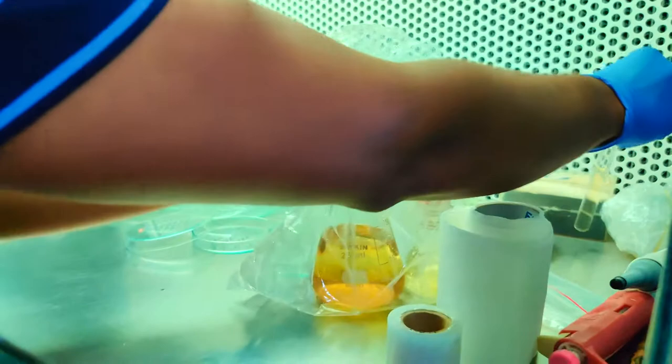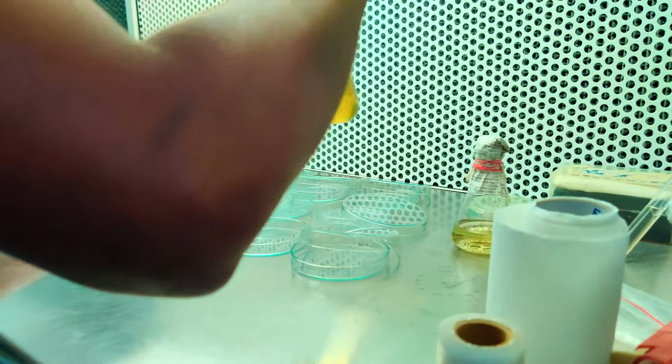Here, the broth we are taking out, and then we will take out the agar safely and carefully. If you are breaking it, that's all your one to two hours of work. Properly mix it and show some flame so that it will get still hot.